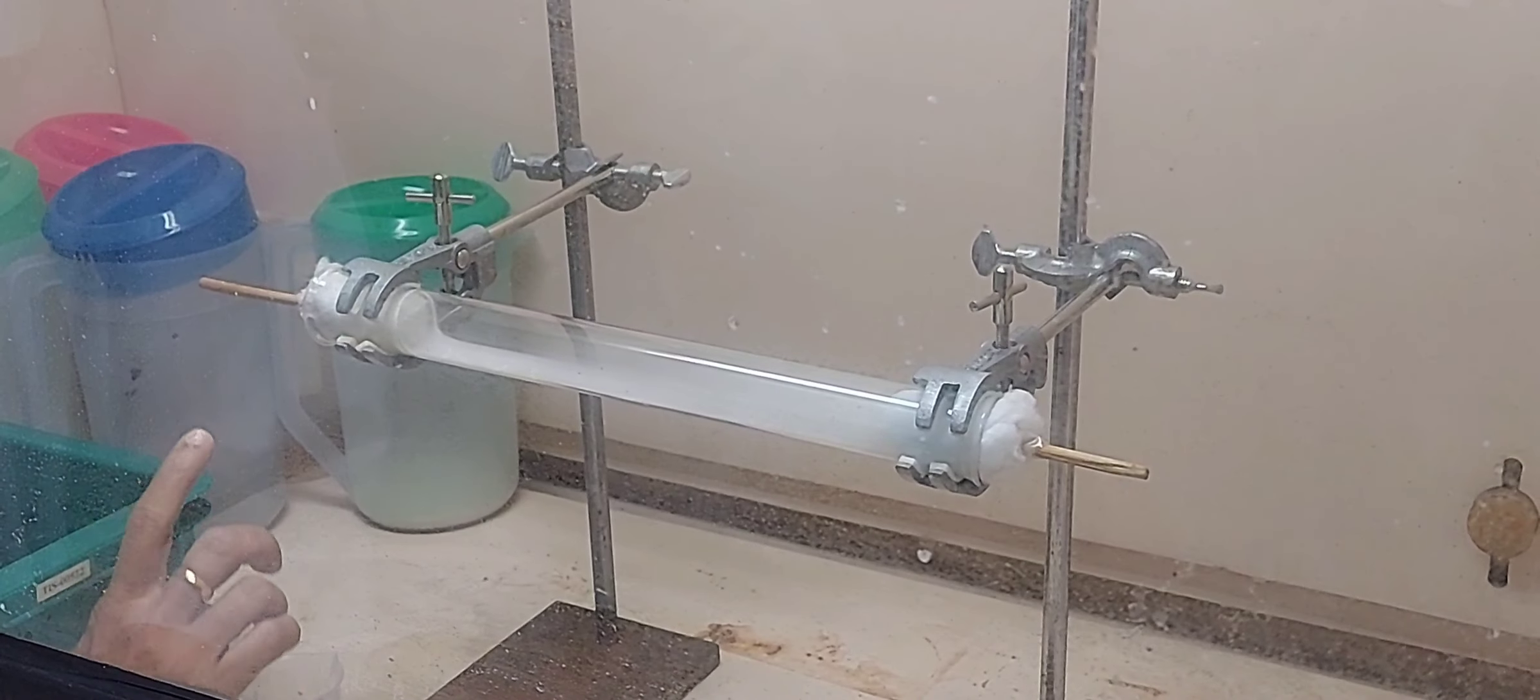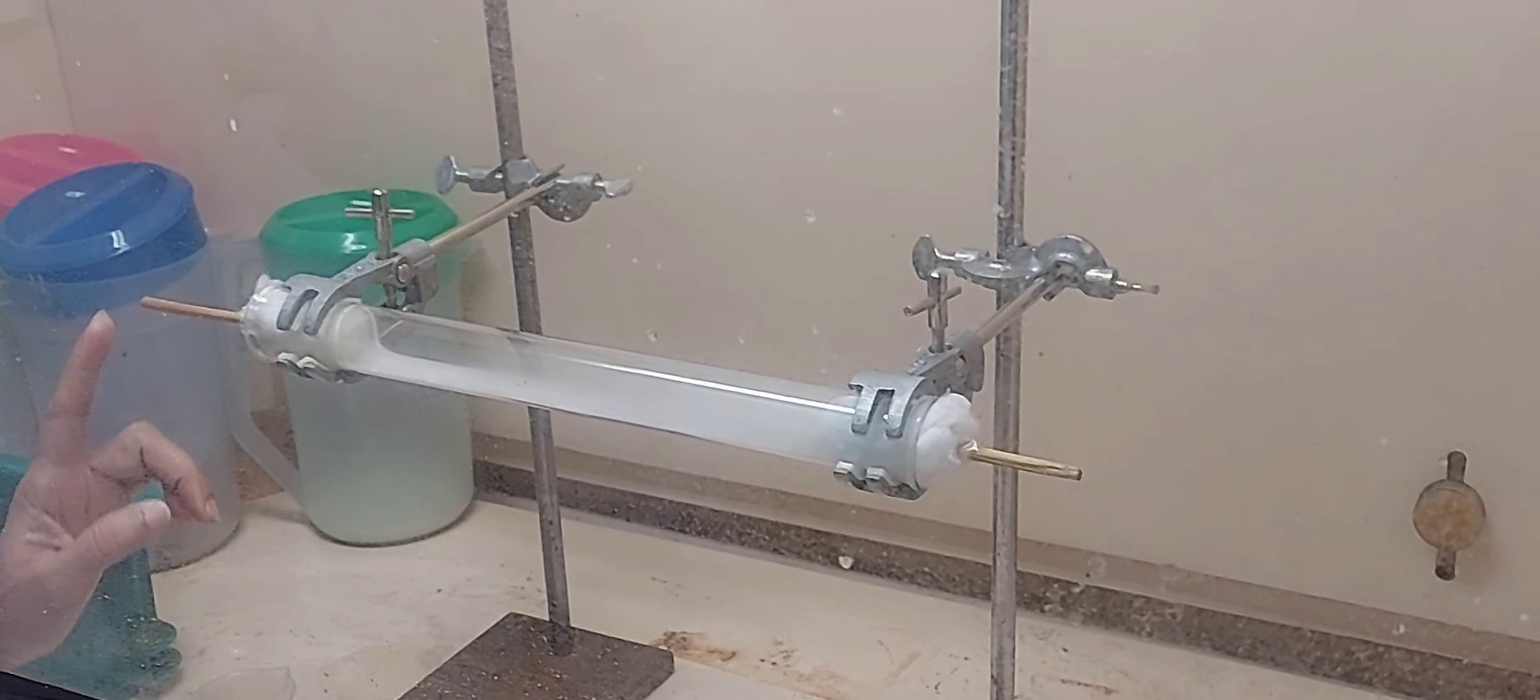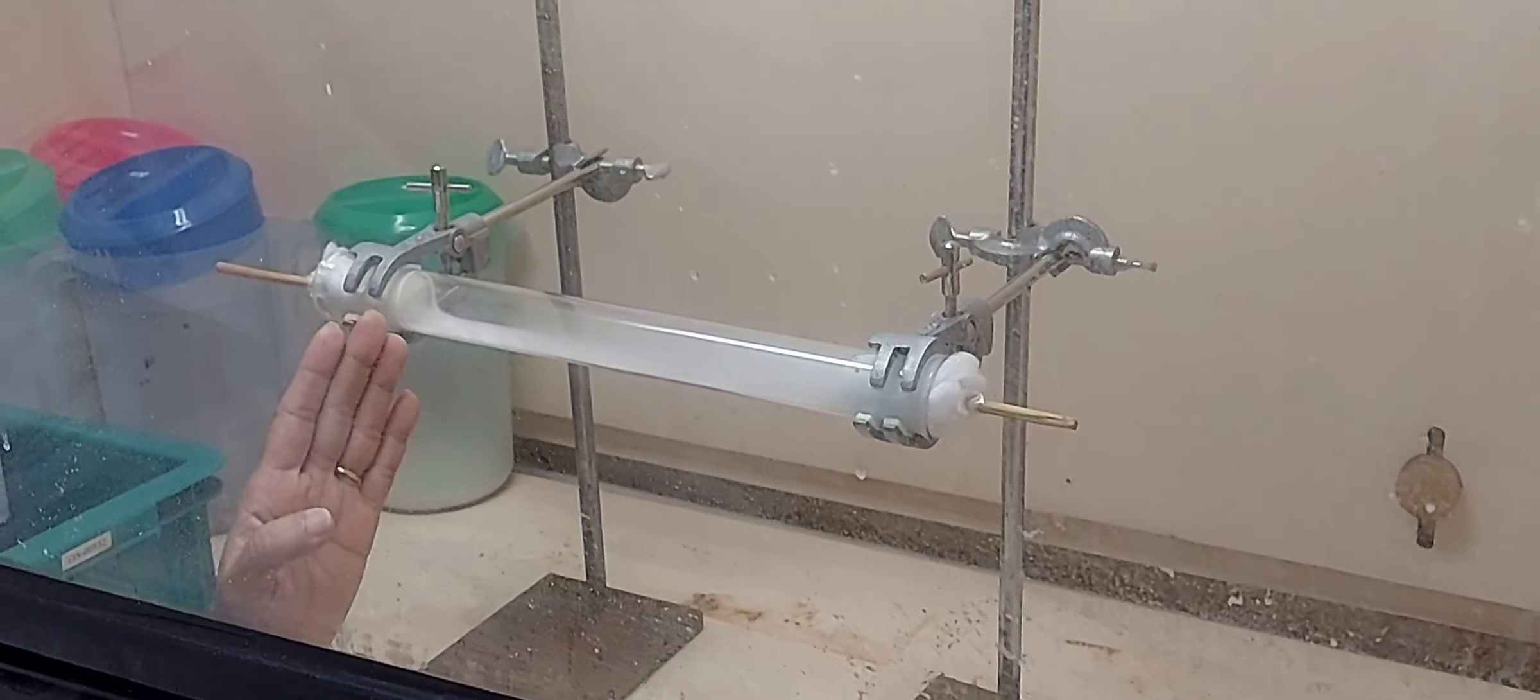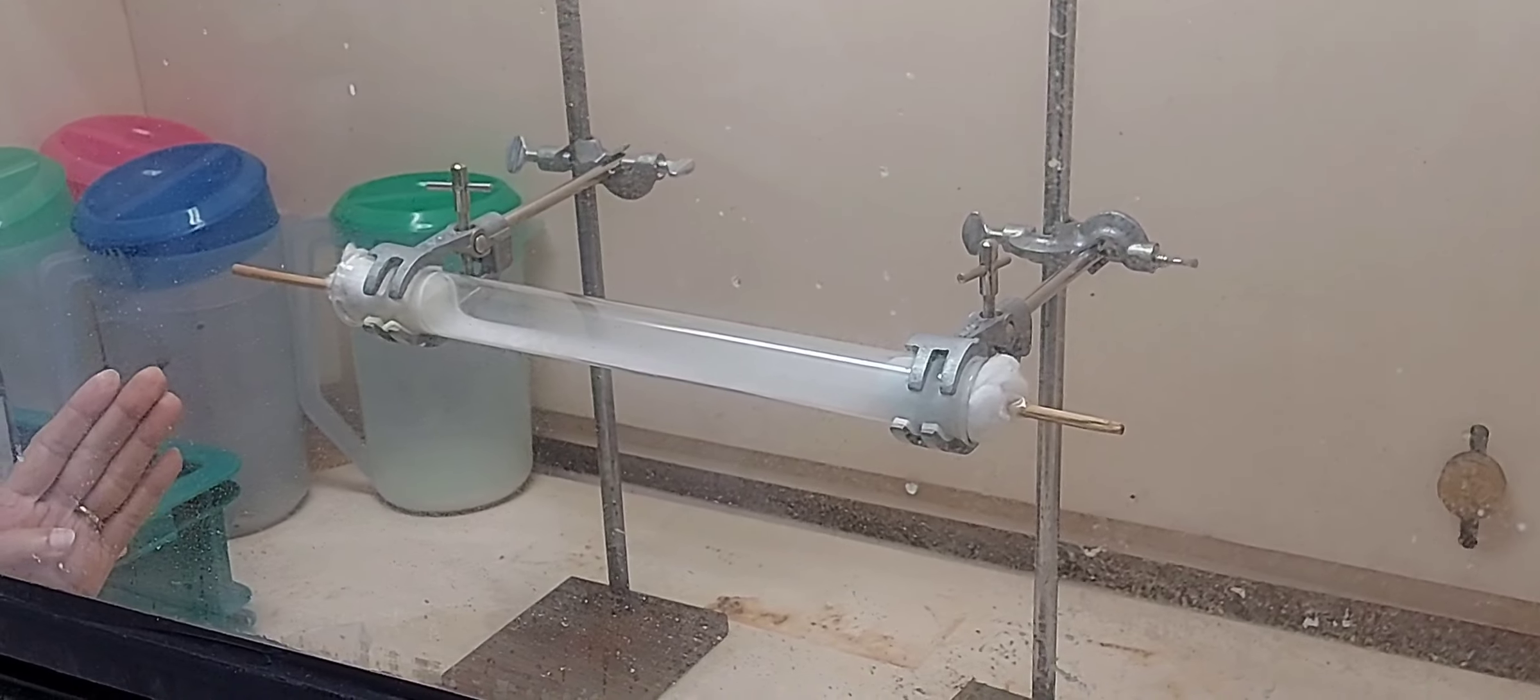So that shows that ammonia gas has traveled faster and reacted with HCl. And then as you see the fume was moving towards the ammonia and then now it is filling up the whole thing.